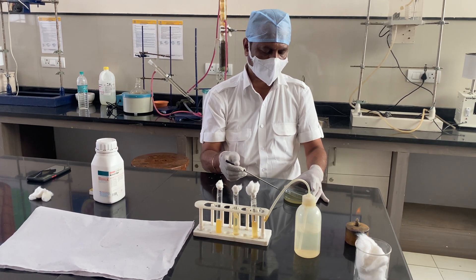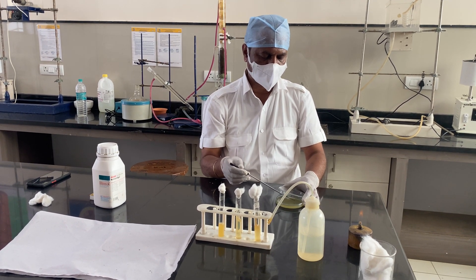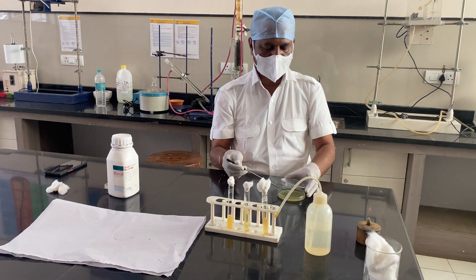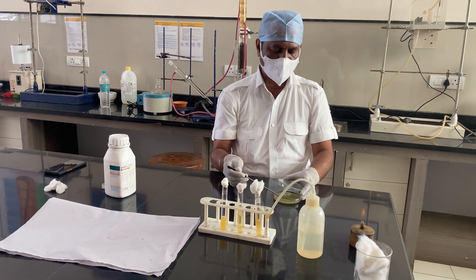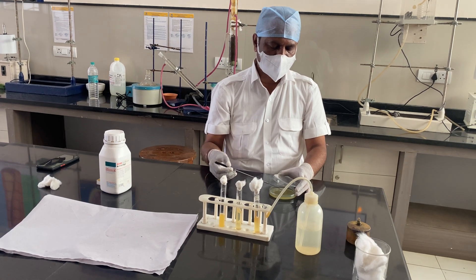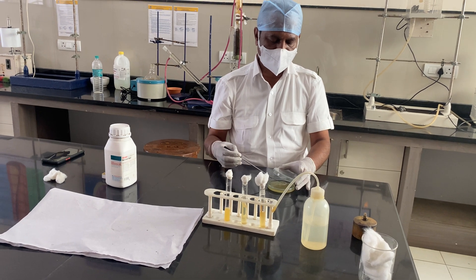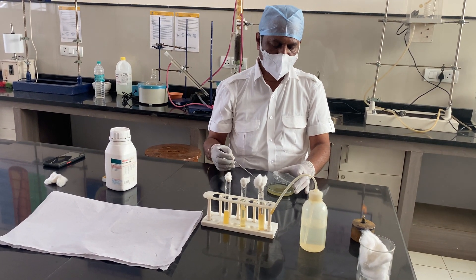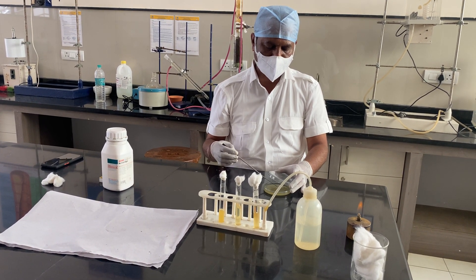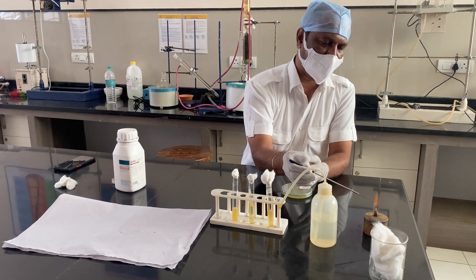I am spreading the sample in a uniform pattern across the plate because whatever sample has been taken should not be concentrated in only one place. Also, note that a lot of pressure should not be applied, because this solidified agar can get disturbed. If the agar surface is disrupted, the cultivation may not be proper. So I am just spreading it gently on the upper surface of the media.